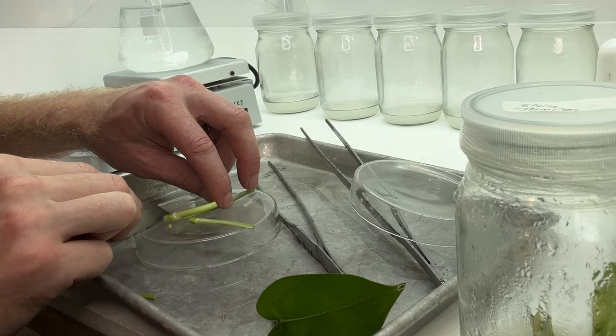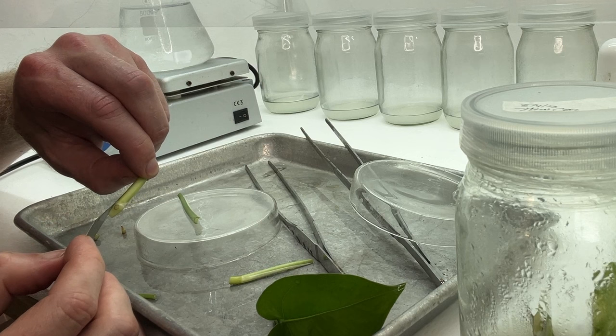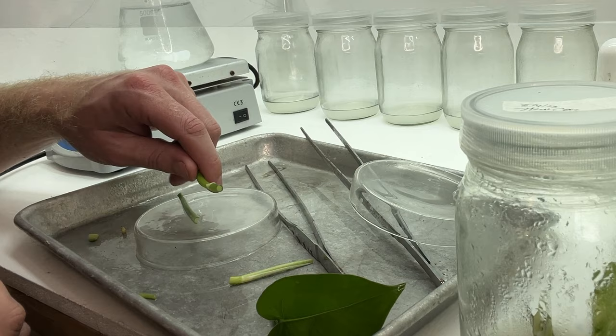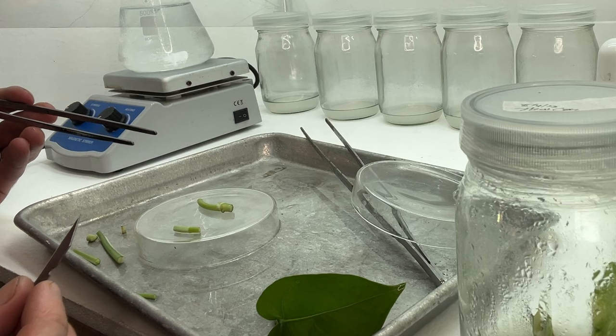This here is just a petiole — a leaf stem. So we'll remove this leaf stem entirely, leaving just this little node here with the root attached, as well as the apical meristem underneath. Typically in a sterile environment, I would not be touching the plantlet — I would be using forceps. I'm going to remove this excess stem at the top. We want to remove as much biomass as possible from the plant so that we don't risk the chance of contamination.